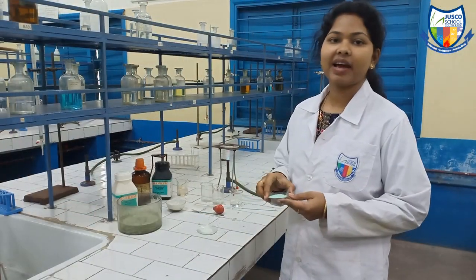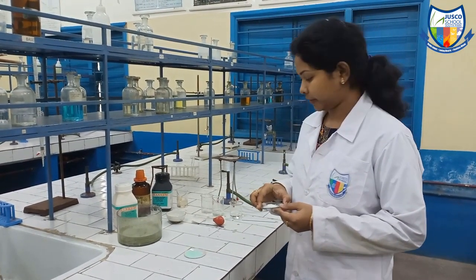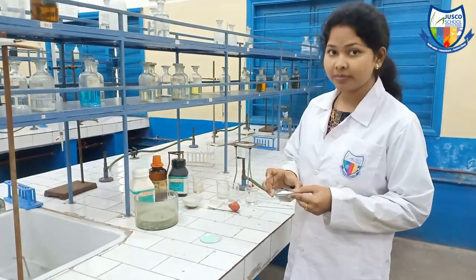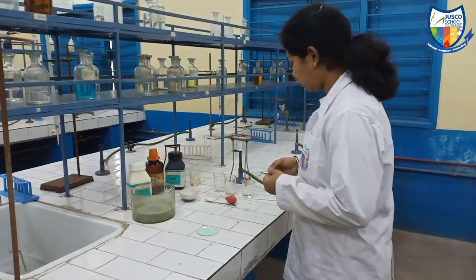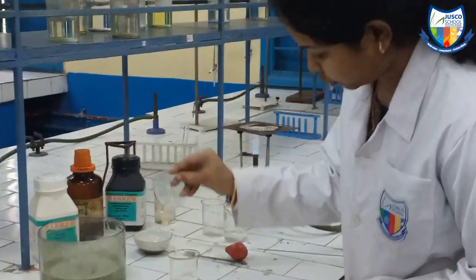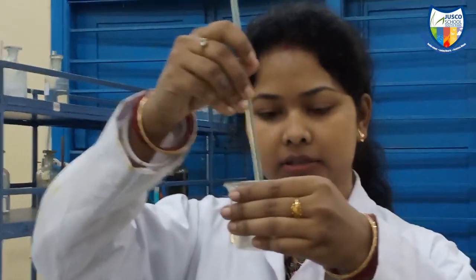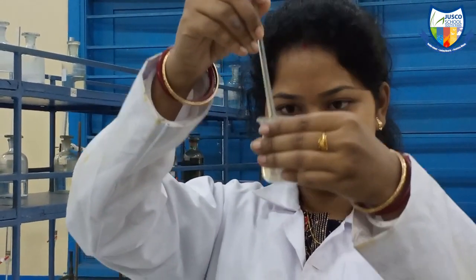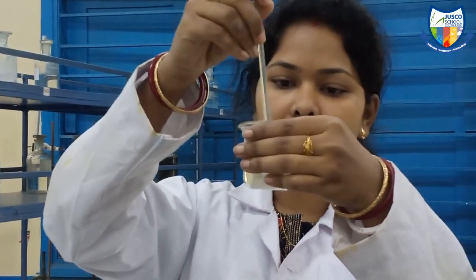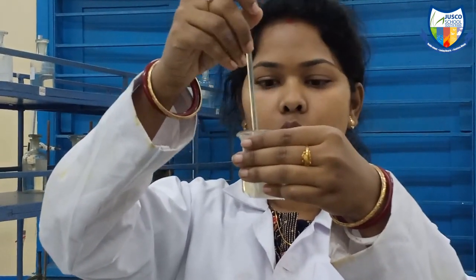We will take 10 grams of ferrous sulphate and 4.5 grams of ammonium sulphate. We will start the practical by dissolving ammonium sulphate in 20 ml of water. Here we take 20 ml of water, put the ammonium salt in, and start dissolving it, stirring continuously with the glass rod until the crystals dissolve and the solution is prepared.